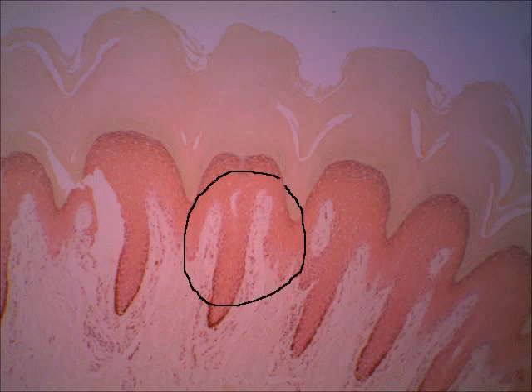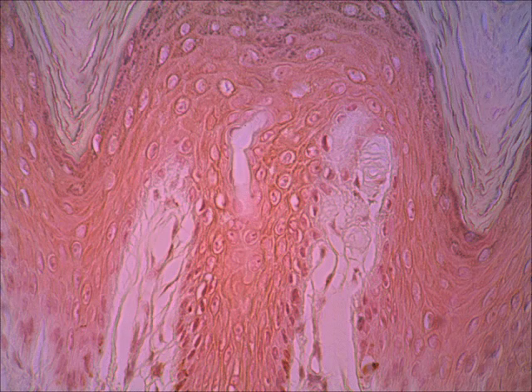So now we're going from scanning to our low power objective, and I see a Meissner's corpuscle right there. Now you can tell it's a Meissner's corpuscle because, I know this sounds silly, but it just looks kind of swirly. Looks like a little tornado in there. I believe there's another one right here at the tip of the pointer. On this magnification, that's difficult to see. But if we move on to this next slide, you're going to see, I believe it's this area, on a higher view. So let's move to the higher view and we'll see that.